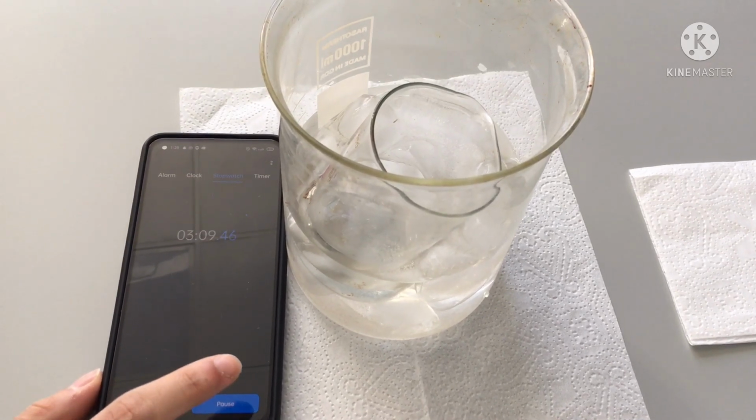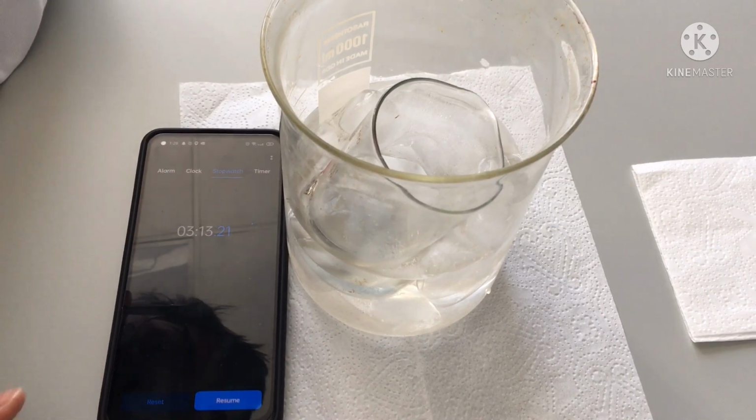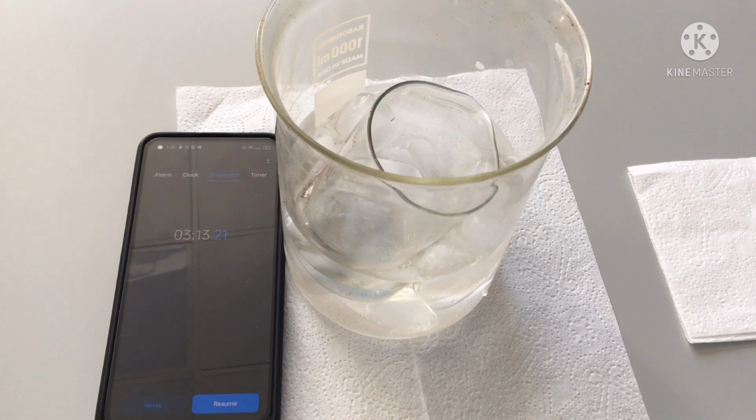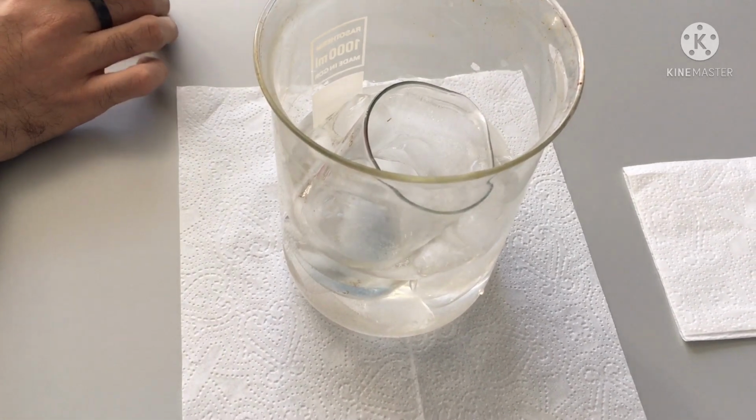Should I stop? Will the reaction start or change fast? It starts, yes, it starts. So stop. Yes. Okay. But it's long, see? It will be fast, so you need to be ready. 3 minutes, 13 seconds.